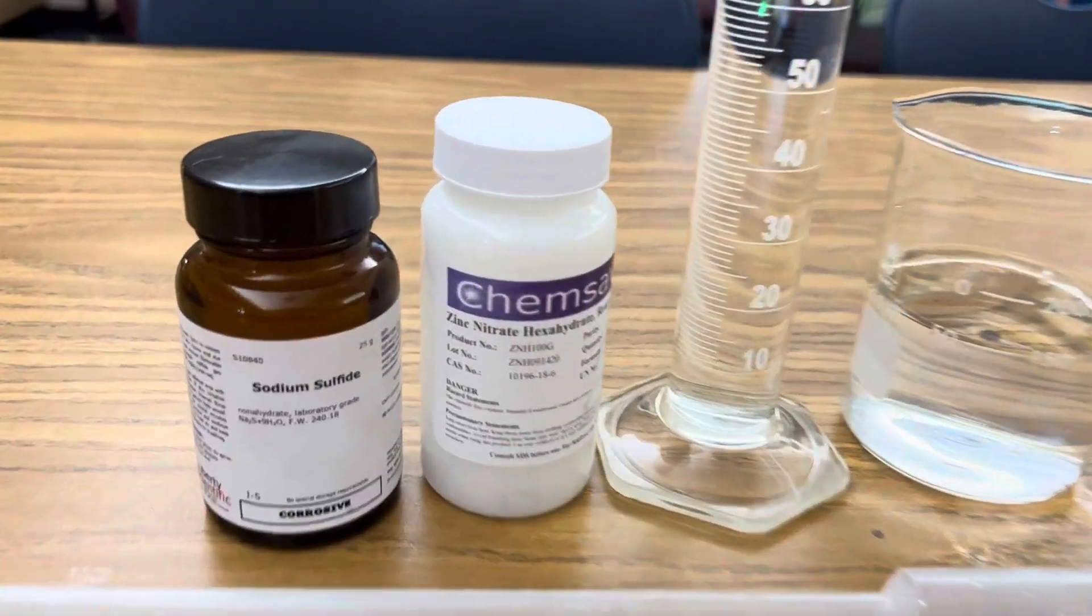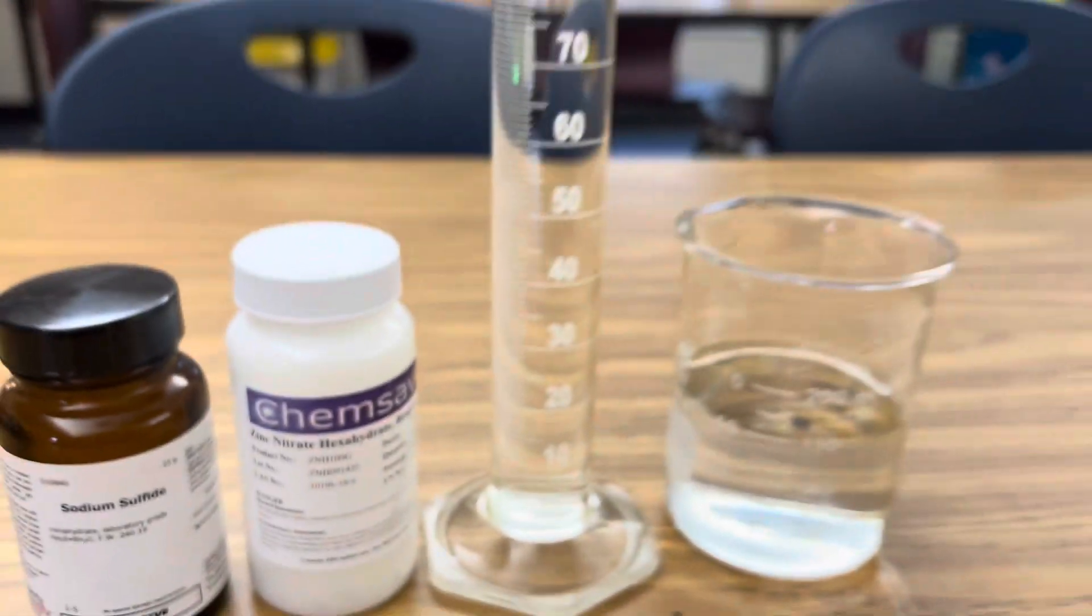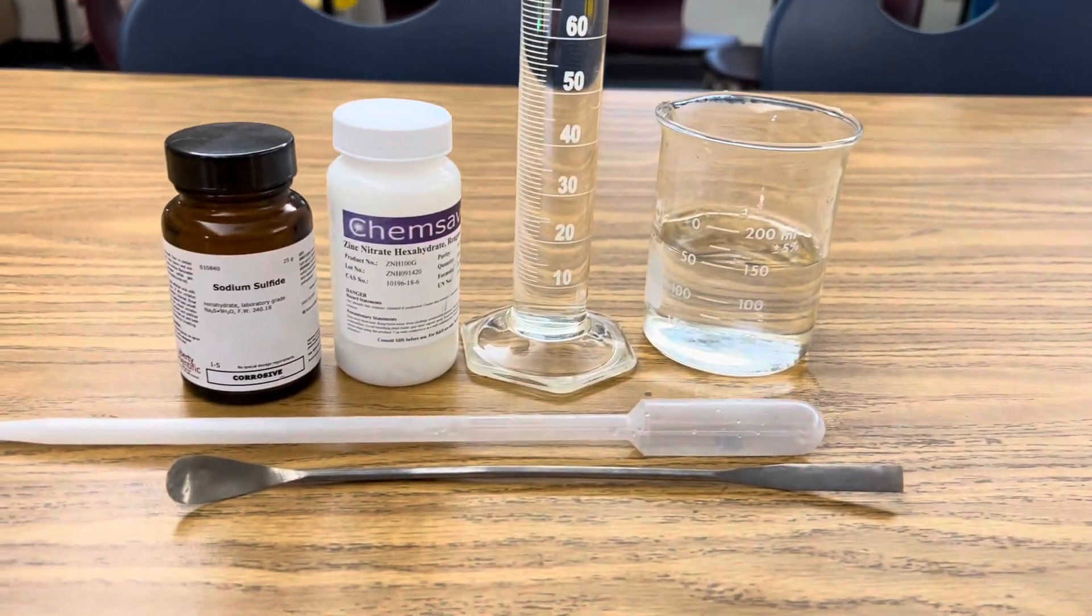All I'm using for this reaction is sodium sulfide, zinc nitrate, a graduated cylinder, a beaker, my dropper, and a spoon.